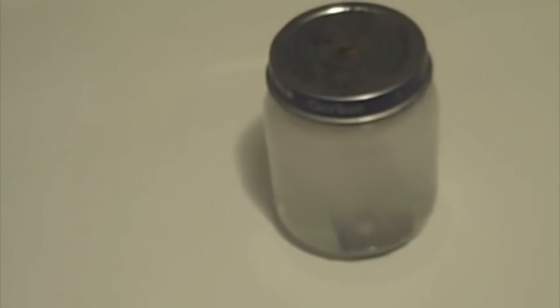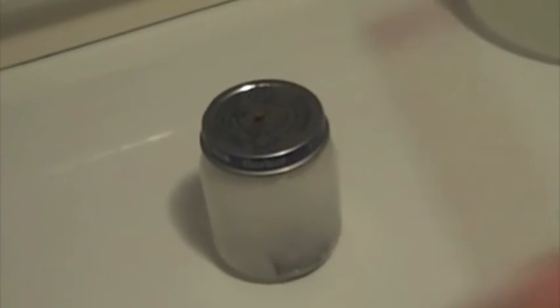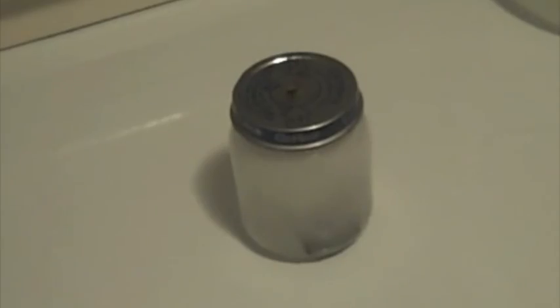Will actually strike anywhere. I let it sit there for a long time, which means that the hydrogen built up, which is sort of a bad thing, and you'll see why that's bad. Well, it blew up.